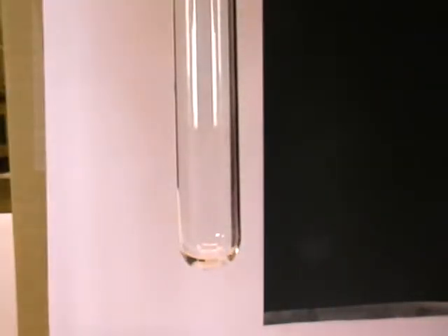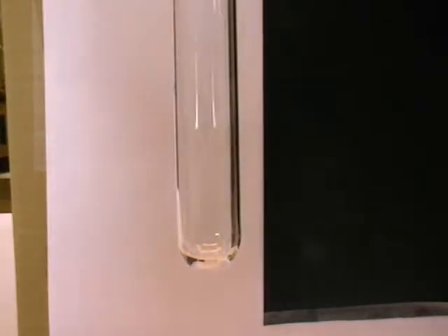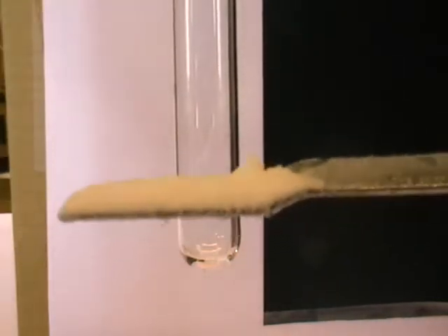Here I have sodium chloride. Sodium chloride is a white crystalline salt, as you know, ordinary table salt.